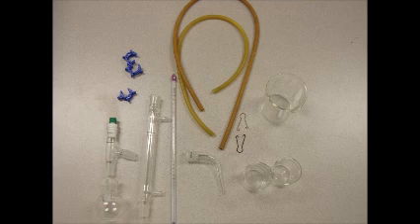After this, the distilling apparatus must be built. The first stage of this is to gather your round bottom flask and fill it with the mixture that you are going to distill.